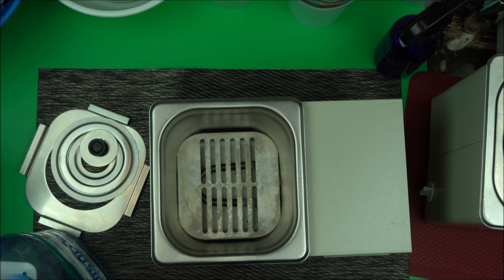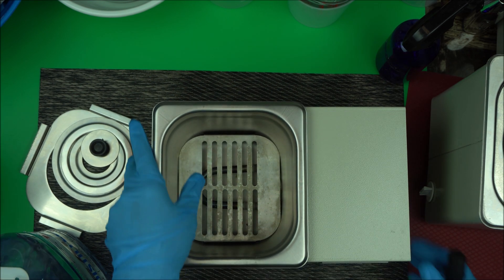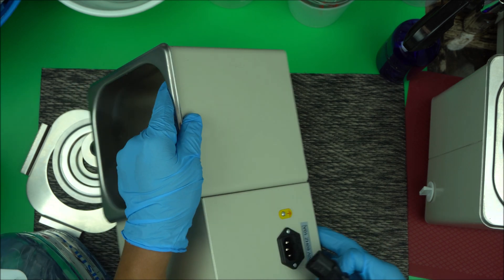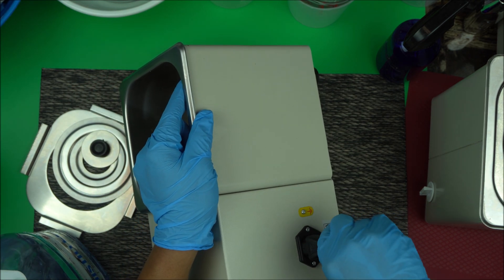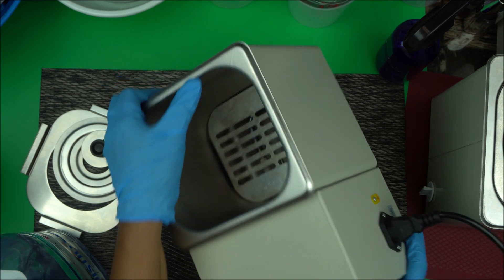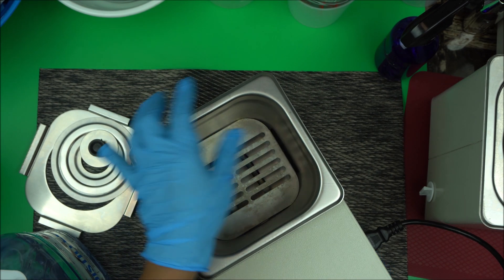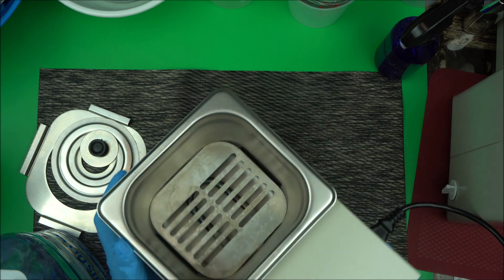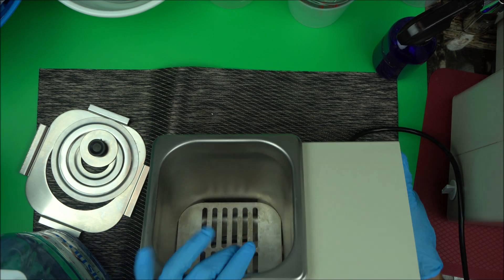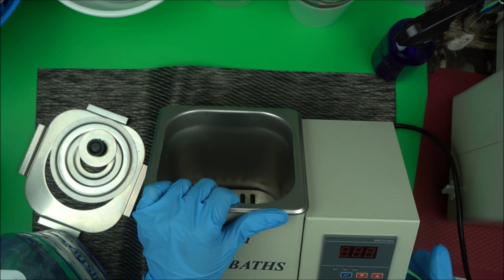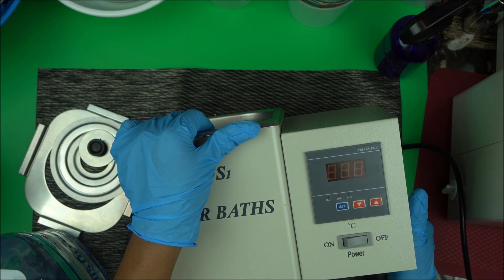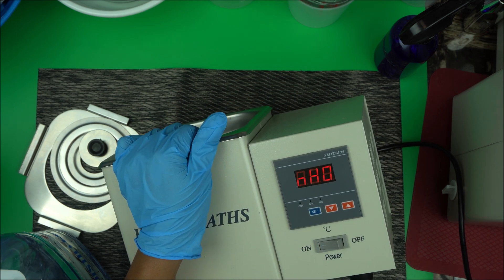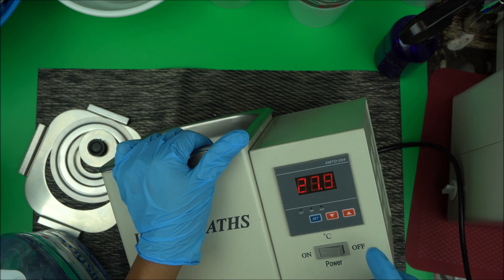The first thing you want to do is turn on your water bath. It comes with a plug. You plug it at the back here. Be careful when working with electricity. Once you have plugged it in, you're going to put in your water.